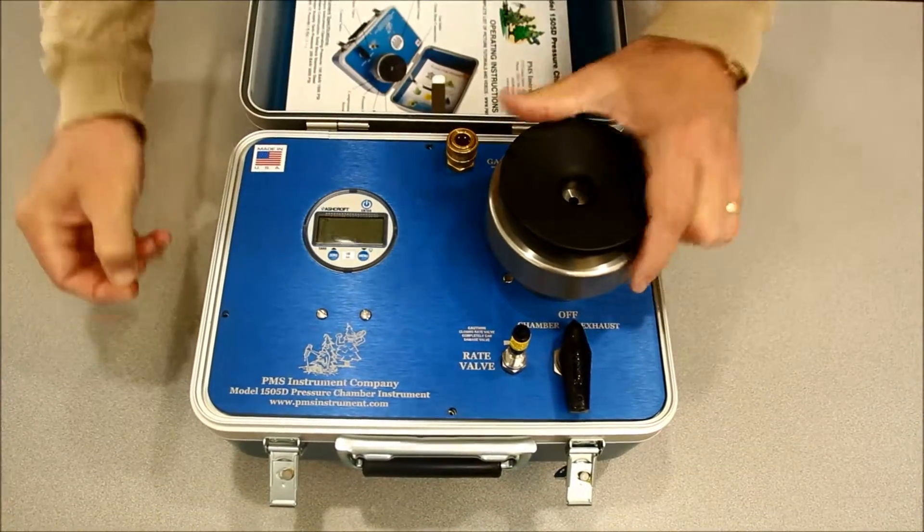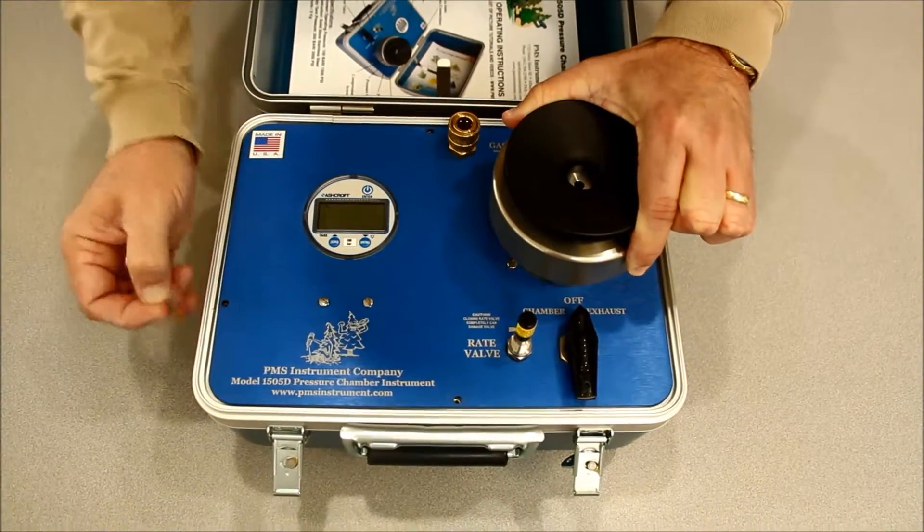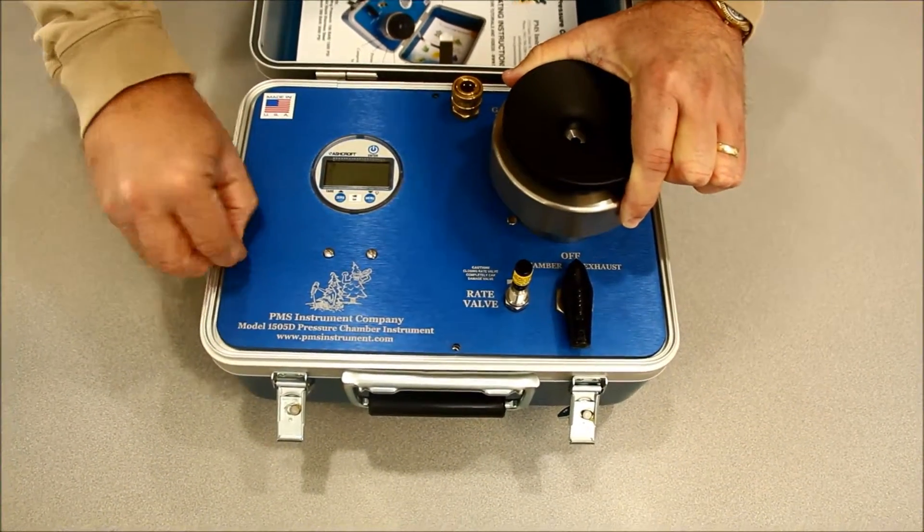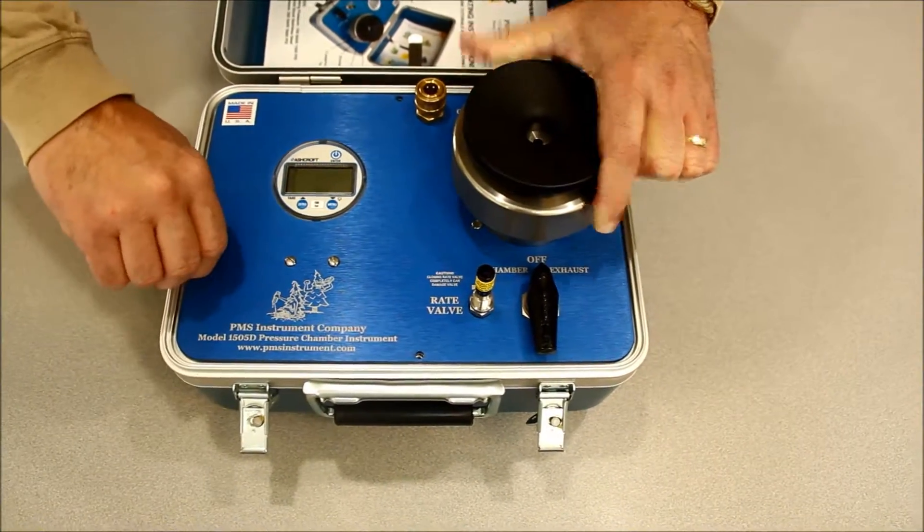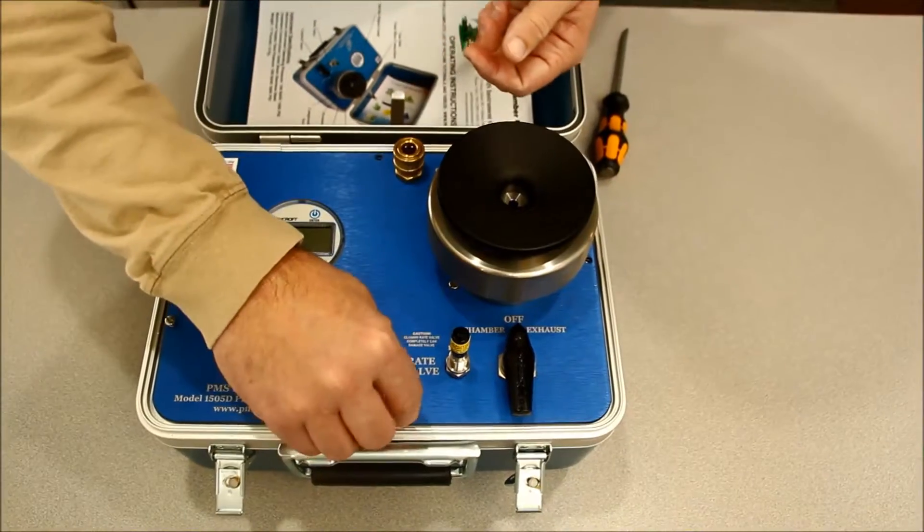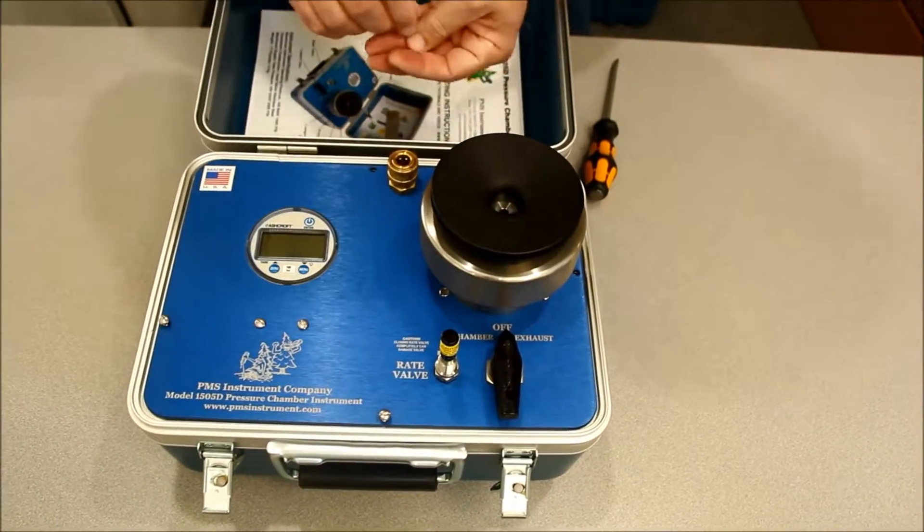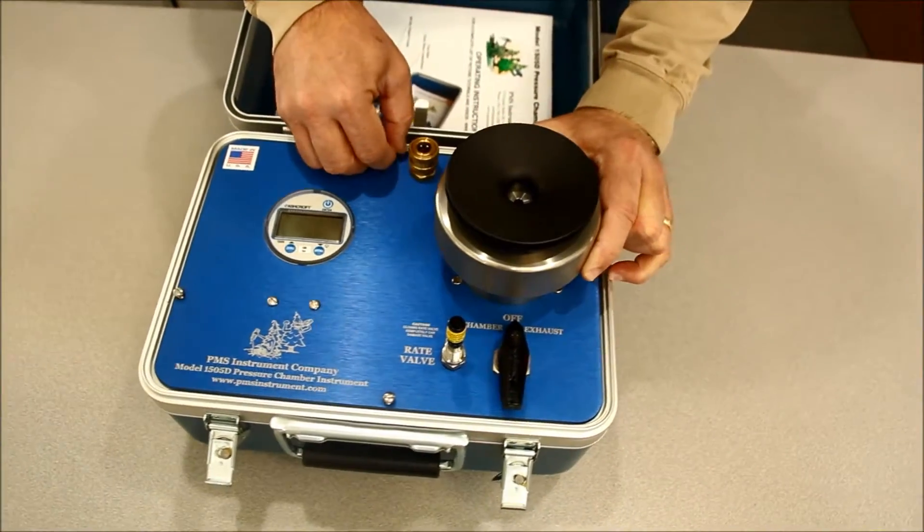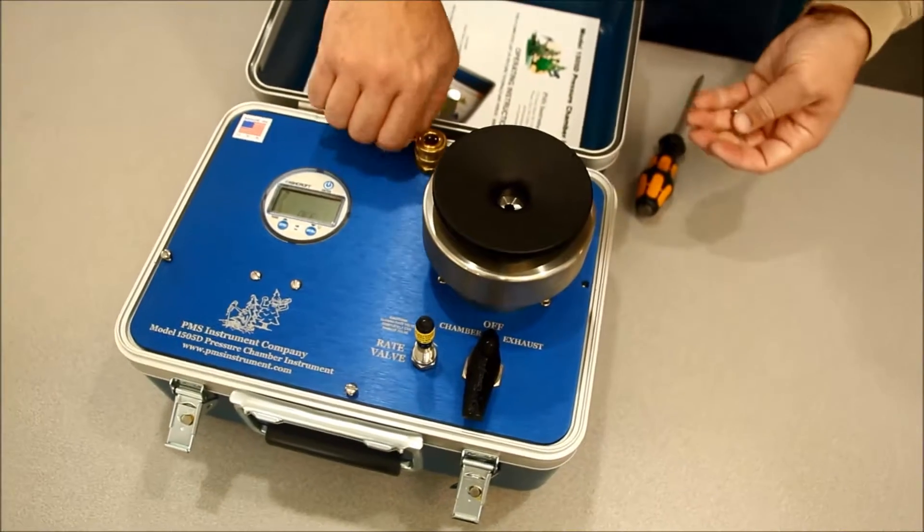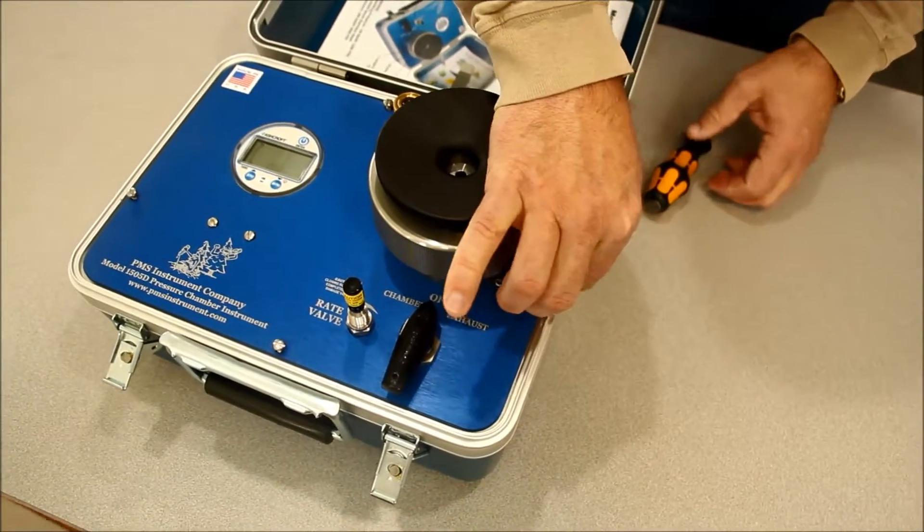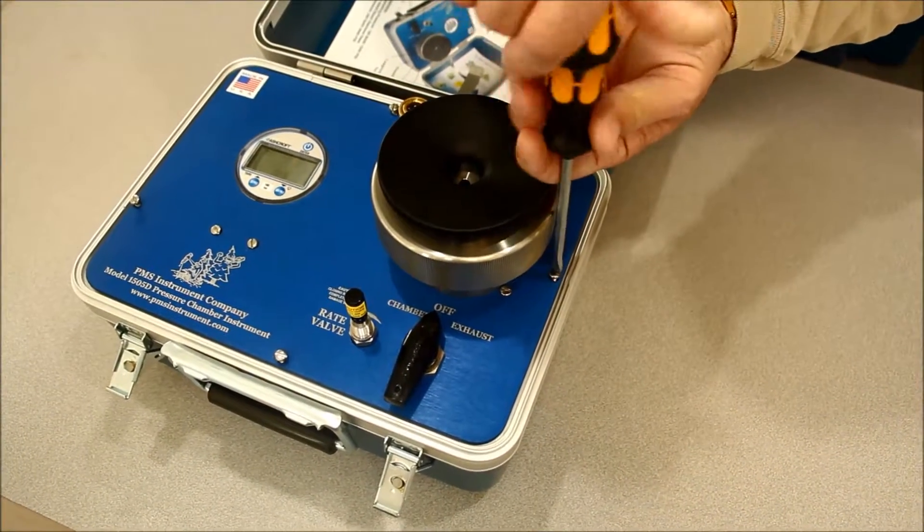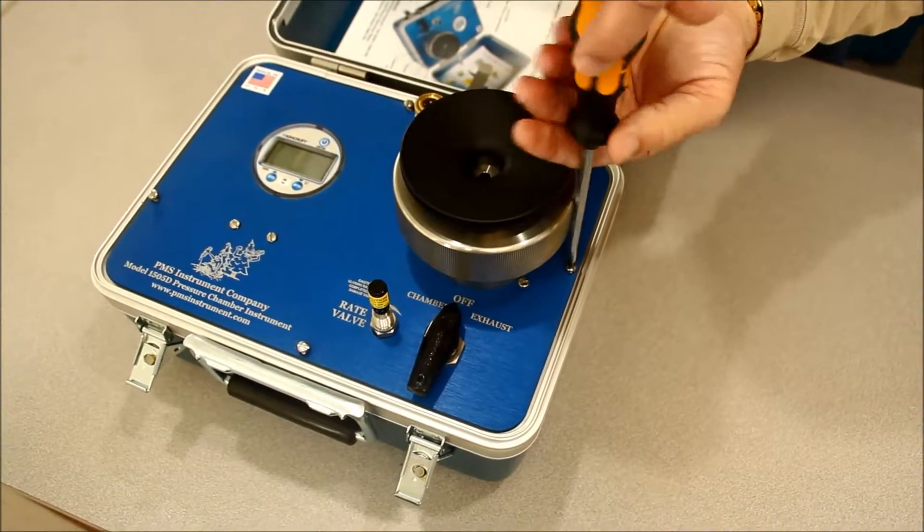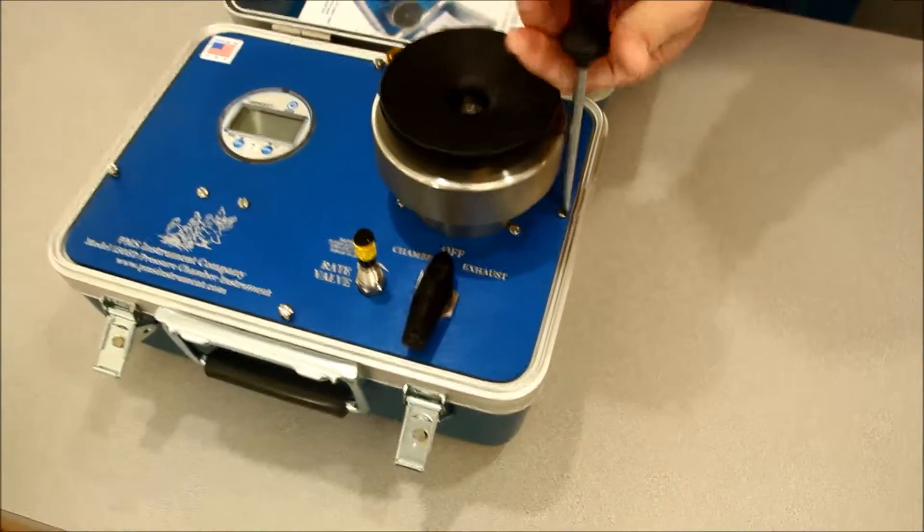Now make sure you line it up well so you don't cross-thread those. Maybe start with your fingers. Those are just going to be screwed back in. They don't have to go very tight, just tight enough to hold it firmly.